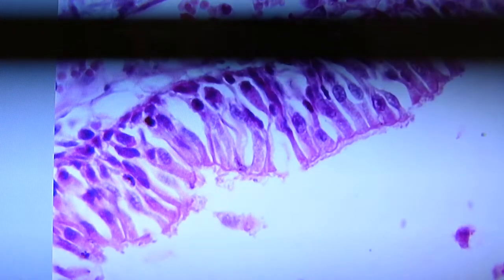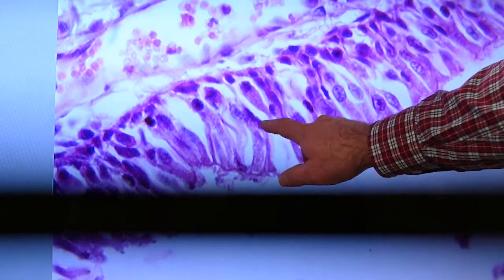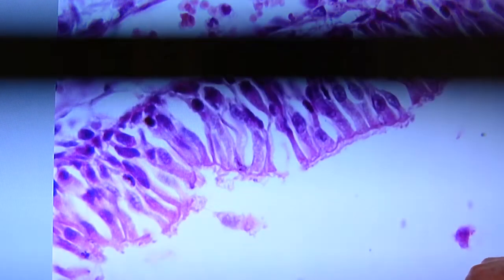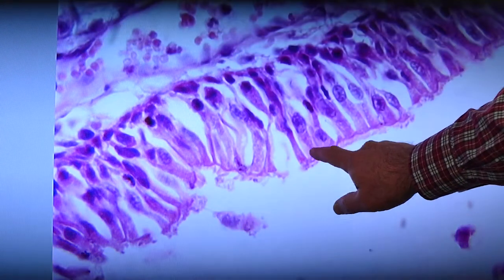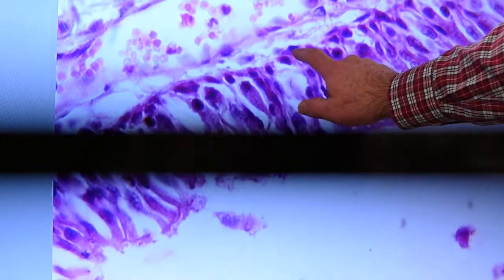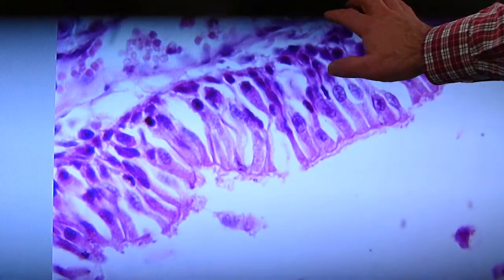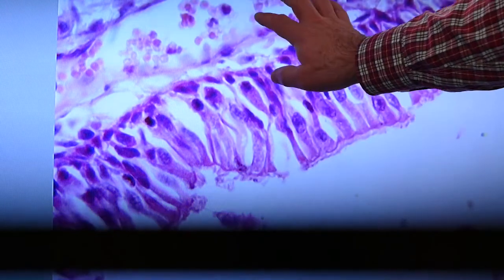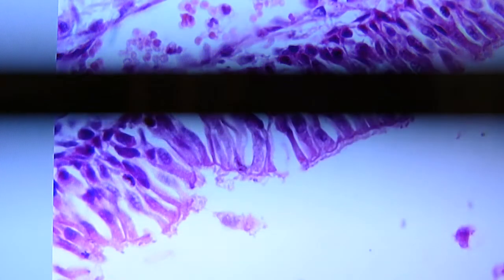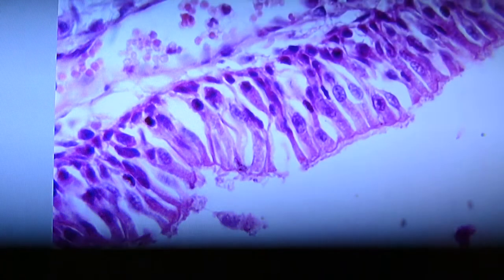Another view. Oh, there's a couple of olfactory cells here. A good sustentacular or supporting cells set right here. Basal cell nuclei right along through here. Loose connective tissue in the lamina propria and lots of blood cells up there, so that must be a venule in the wall of the mucosal membrane.